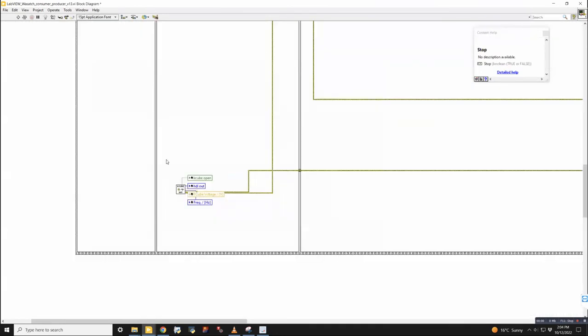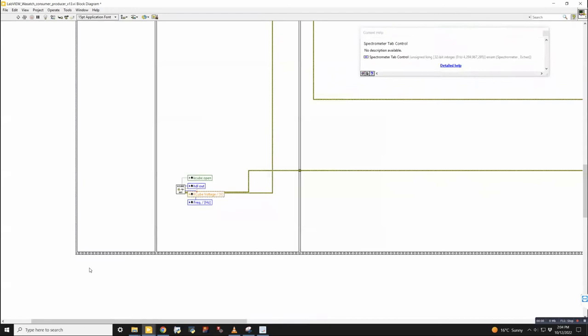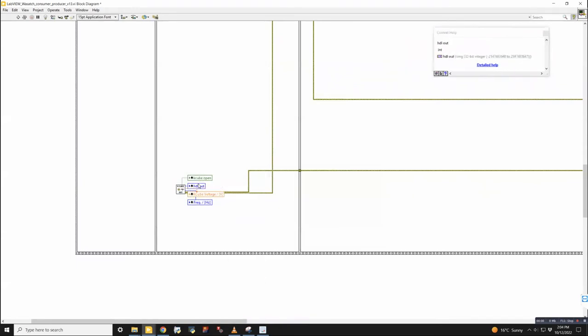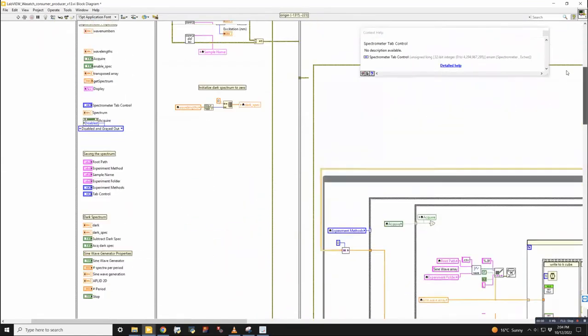So that's what we always do, is we initialize the hardware in this kind of way, and then we take information out of it that we're interested in. Like the frequency, the K-Cube voltage. So this one is the slider, it'll output to there. And then the handle out will output directly to here, what we were checking before. We do that for right now, 2 pieces of hardware.